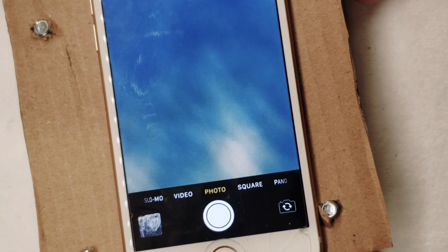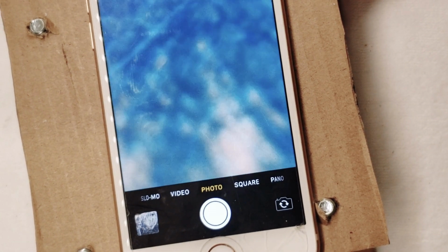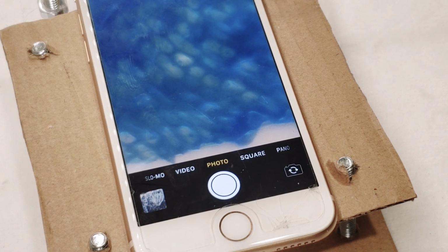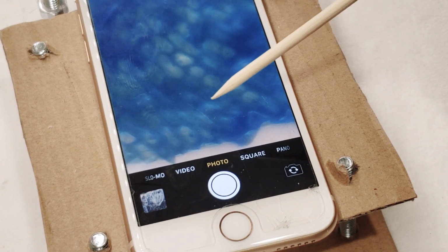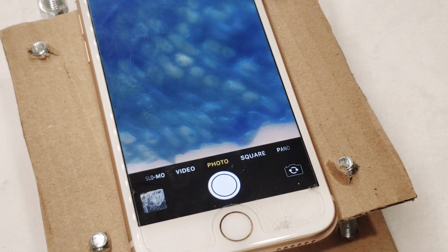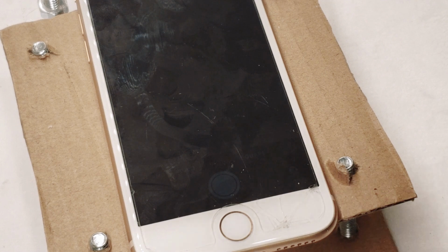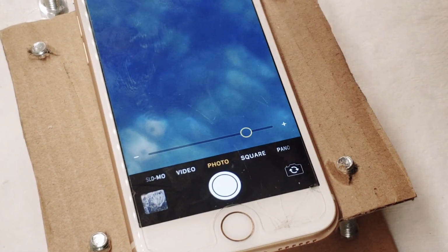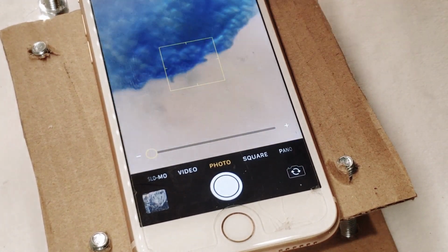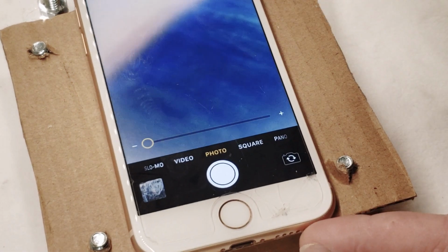Some places it's a little... There we go. That's a good example right there. And I can bring it up just with my fingers. Those darker spots, especially, I think probably the easiest one to see, even though it's not very center, is right there. You can see the nucleus very well, and these cell walls. The definition is being lost because the dye has been in there for a rather long time. We can zoom in on this, but it's not going to get focused a little better. But honestly, zoomed out to here is not bad.